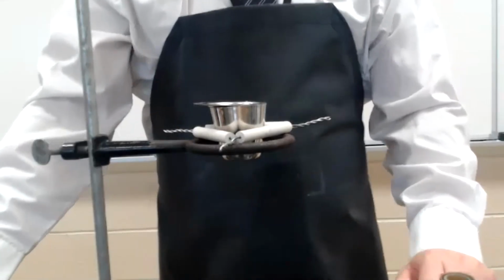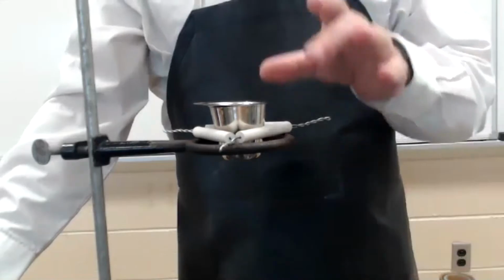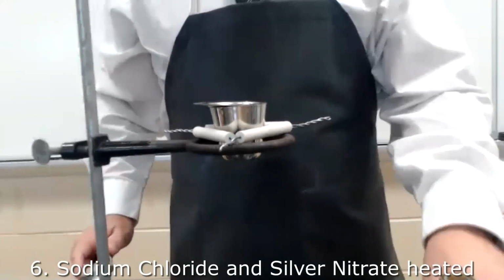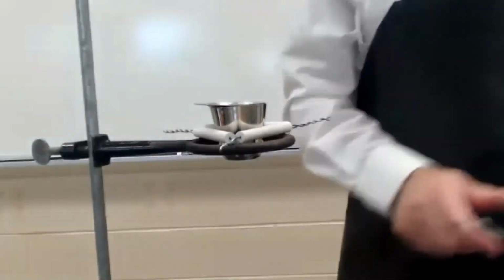We're now looking at our solution, our original solution, back in the crucible. I've placed it back on top of the iron ring and clay triangle, and again, the lid is ajar. We're going to once again heat this sample up to drive off any water.